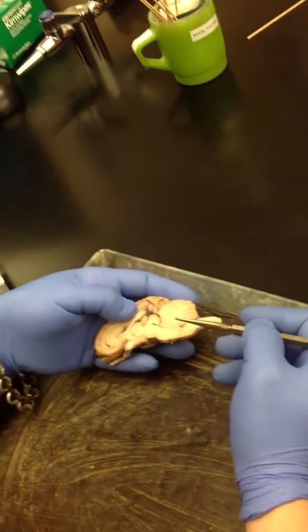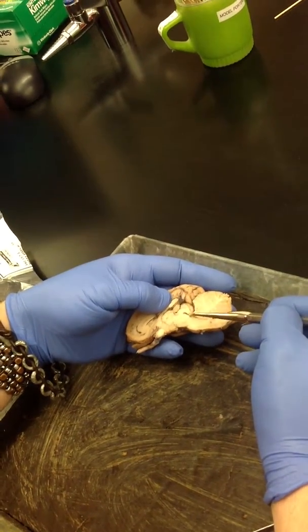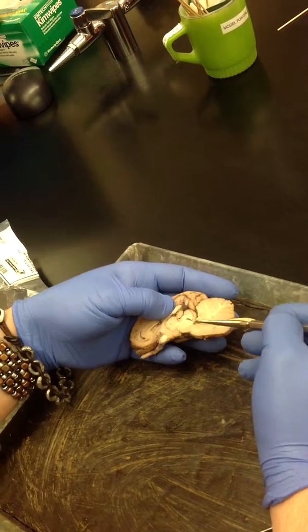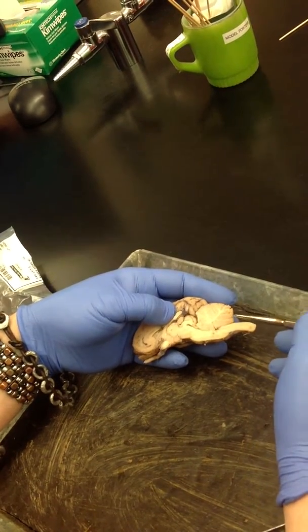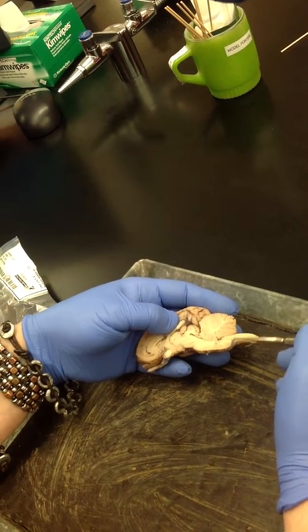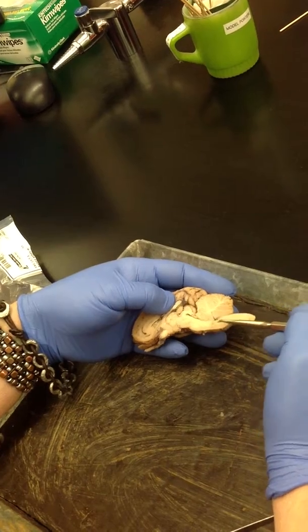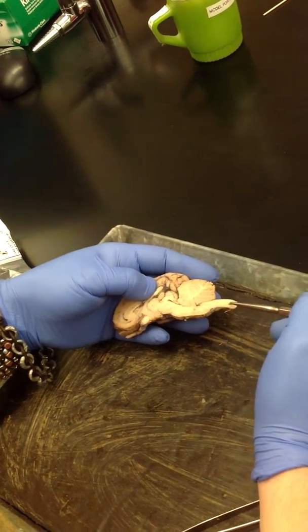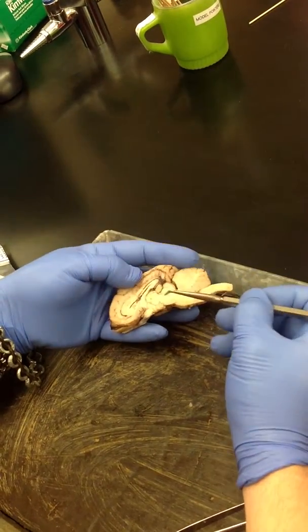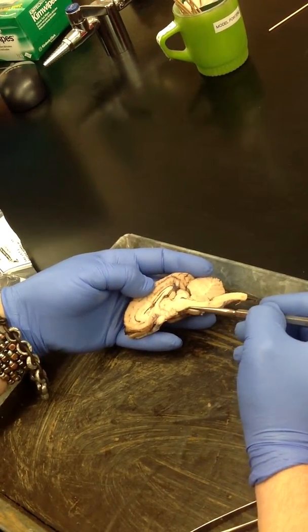So the way I usually do it is I look here where the cerebellum kind of starts, and I come straight across, and that's where the pons begins. And then where the cerebellum ends, if I come straight across, that's where the medulla oblongata ends. So I kind of use that as a point of reference. So pons, medulla oblongata. Then you're in spinal cord. Now let's come back up here to the midbrain, which is this area right here.